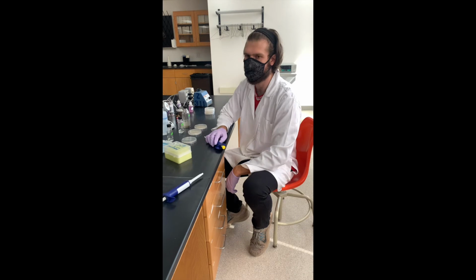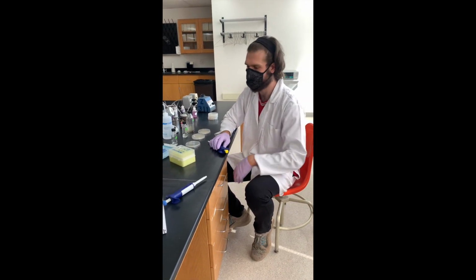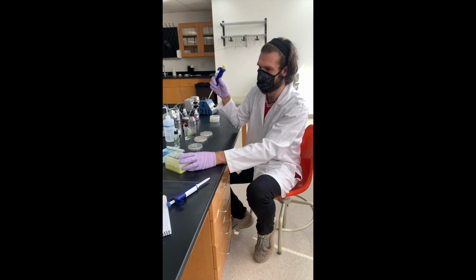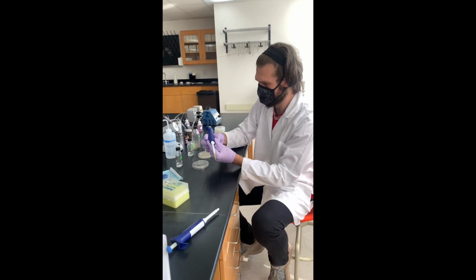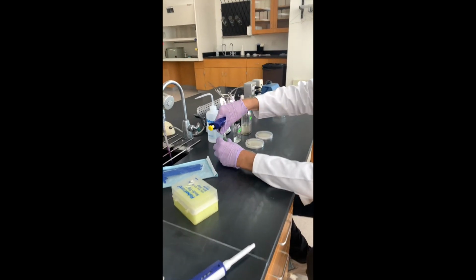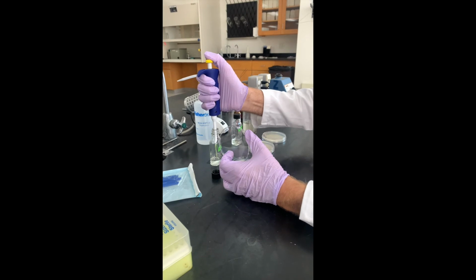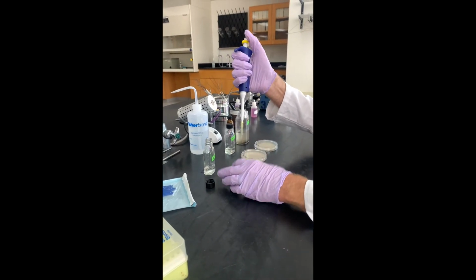So now we're ready to put the dilutions onto nitrate salt plates with nystatin added. Nystatin being an antifungal agent, we're trying to grow only bacteria on our plates. What we're going to do is spread 0.1 mils or 100 microliters of each of these dilutions. So I've got my pipette set to 100 microliters here, and we'll start off spreading the 10 to the negative 4 dilution. So first thing, 100 microliters right onto the middle of the plate there.